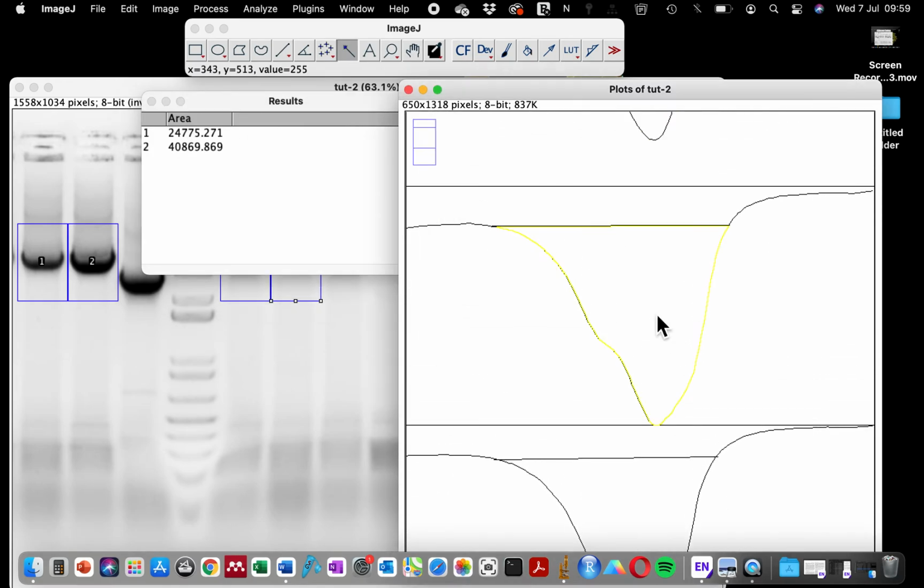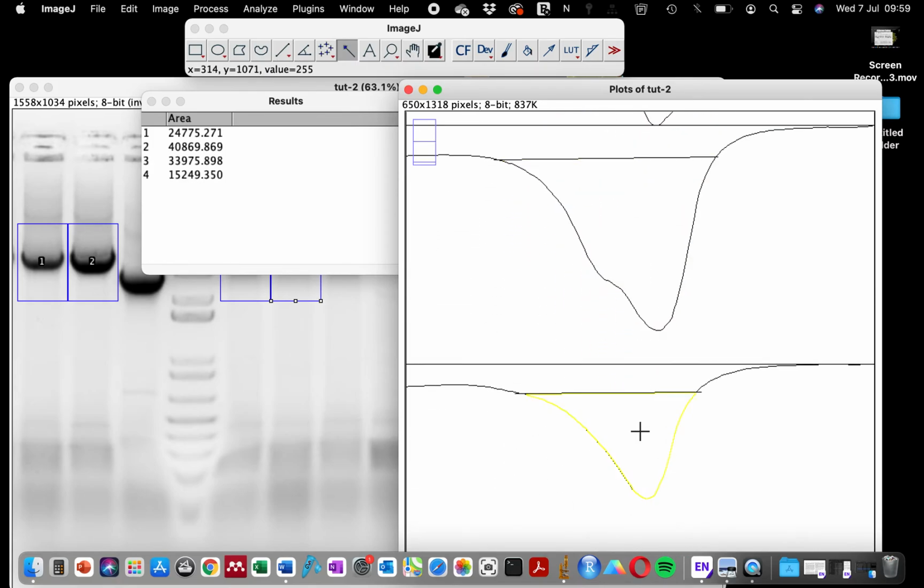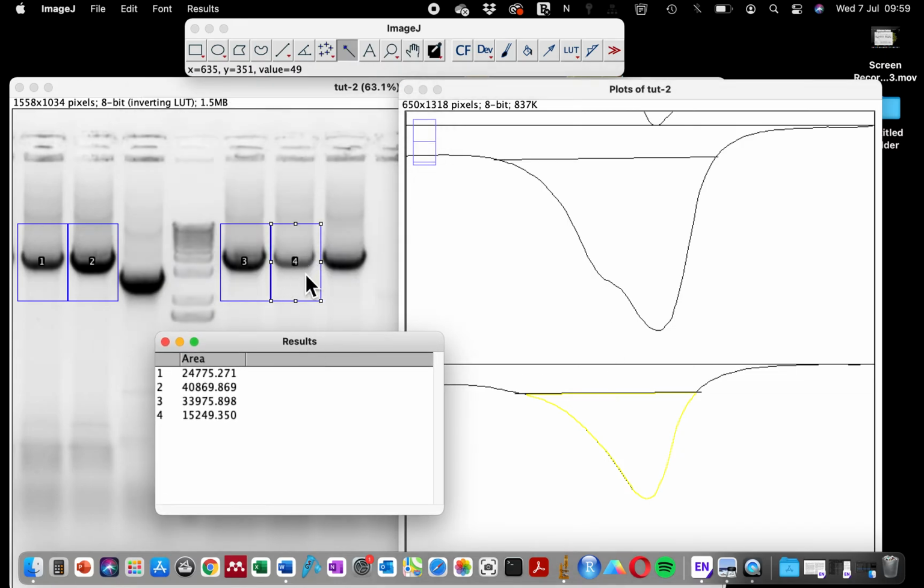That is the size of the first band in area. When you click inside the second one, can you see it also recognizes the peak and it has given us the size as well. Do this for the third one and for the fourth one. Can you see that the fourth band, which is the weakest one among the bands we are quantifying, the value is lower. And the second band that has the strongest signal has the highest number. It's as simple as this.